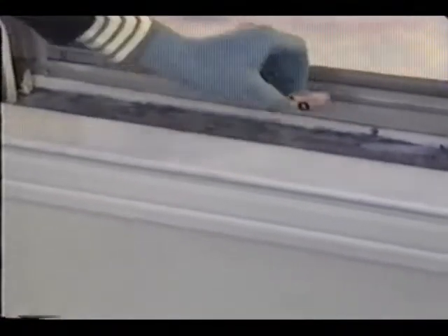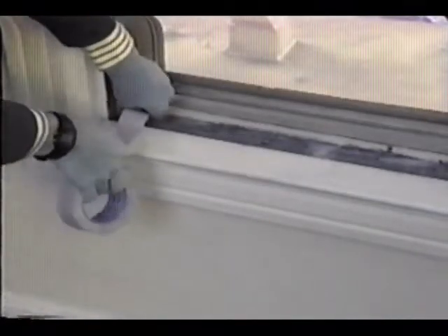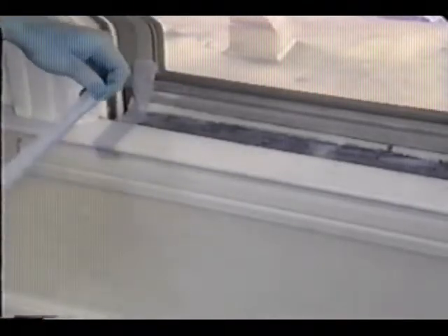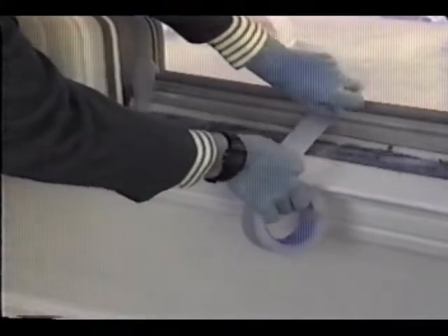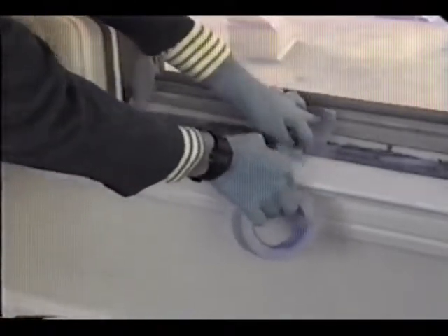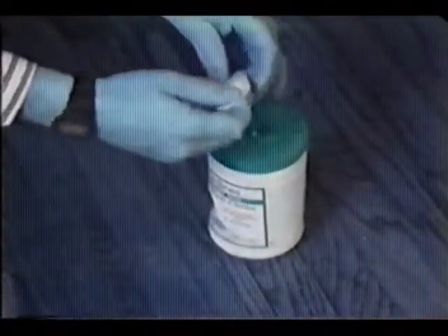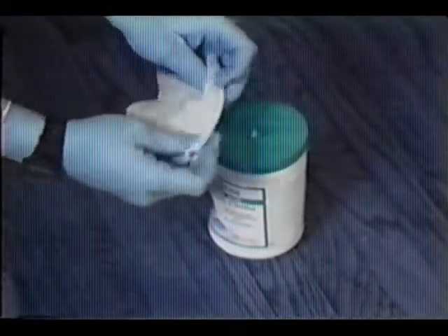For interior windowsills and window troughs, this step is performed in a similar way. Remove all large visible debris. Do not touch the test area yet. Fasten 2 strips of masking tape across the sill or trough to define an area of at least 1/10 of a square foot, or at least 4 inches by 4 inches. The area should be as large as possible, while at the same time allowing you to collect all material in the wipe area. Because of the amount of dust and debris at this location, only half of this trough will be sampled. Dispose of the top disposable wipe to ensure that the wipes are still moist. Do not use wipes that have dried out.